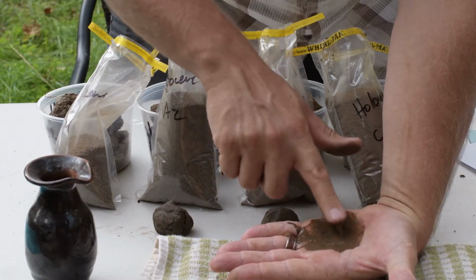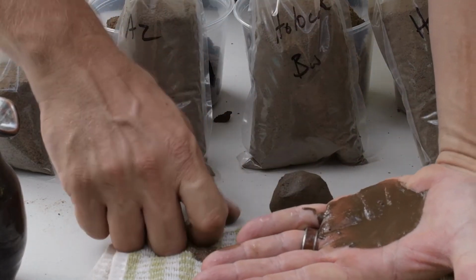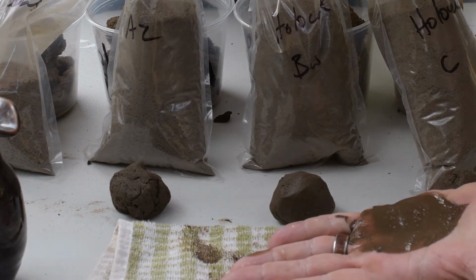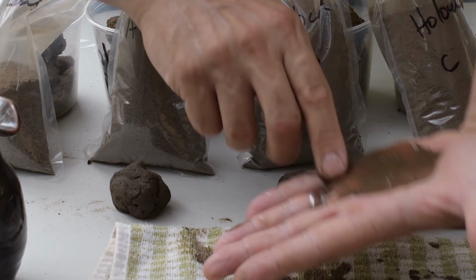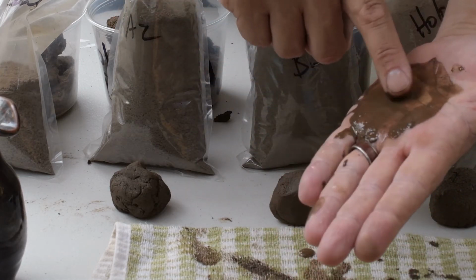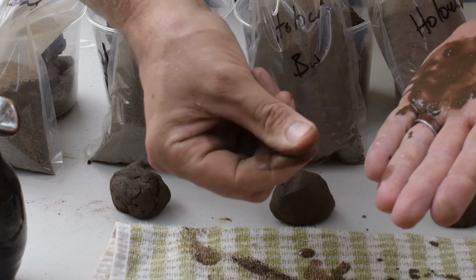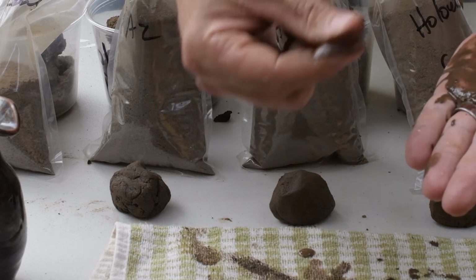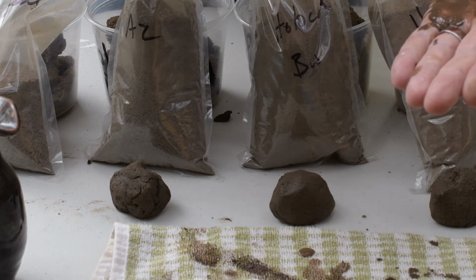There we go. So what's the criteria we're looking for in this one, Irf? Does the soil feel very gritty? It's pretty gritty. I mean, we can see a variety of different sand particles, coarse through medium sand, and even some finer sand. When I pull my finger away, I can feel the softness of some of the smaller particles that aren't sandy. So I would say it's gritty, but not very gritty.